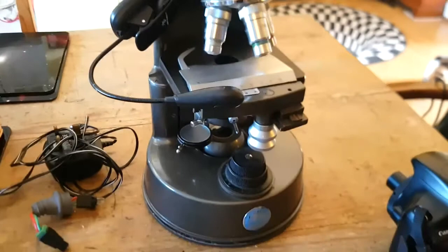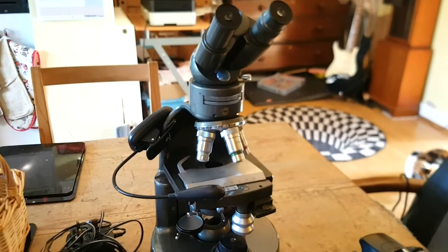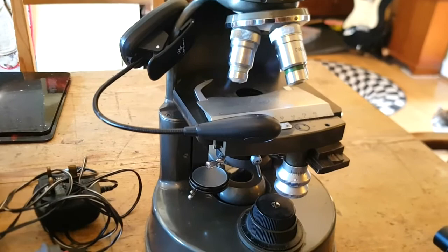A very basic setup, but I've had this microscope for years and I love it. As you'll see in the video, this isn't really the sort of microscope designed for what I'm doing, but I was quite pleased with the results. If you want to find out more, keep watching.